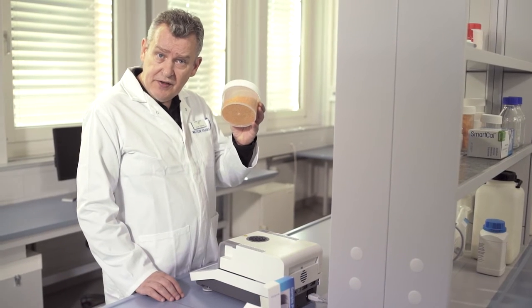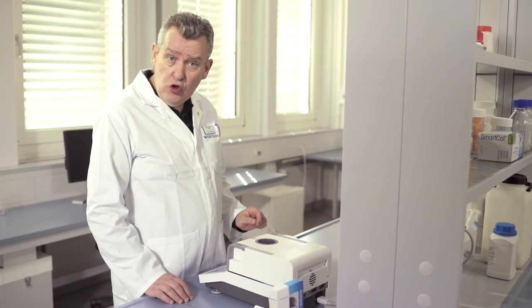Let's perform our first measurement with the HC103 using crushed potato chips as our sample. First, we need to define a new method.